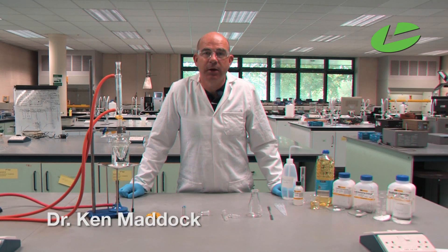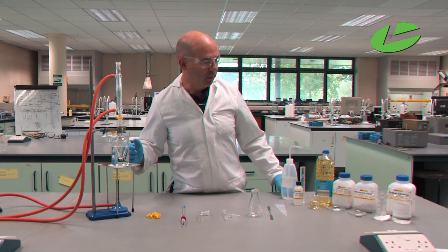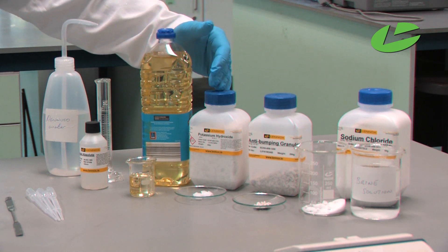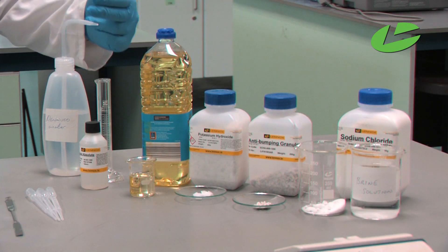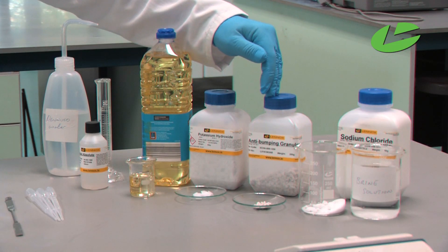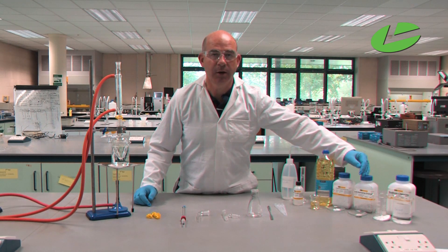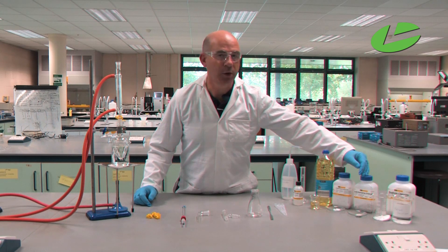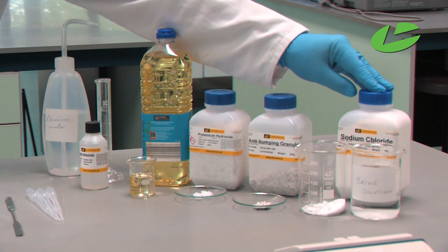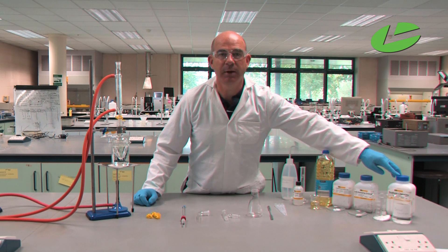In this practical we will be synthesizing soap using a reflux apparatus. We will be refluxing a mixture of cooking oil, potassium hydroxide in a solution of ethanol and water, using anti-bumping granules to control the boiling. Once saponification is complete, we will distill off the ethanol, leaving the soap behind, which will precipitate out with a brine solution made from sodium chloride mixed with water.